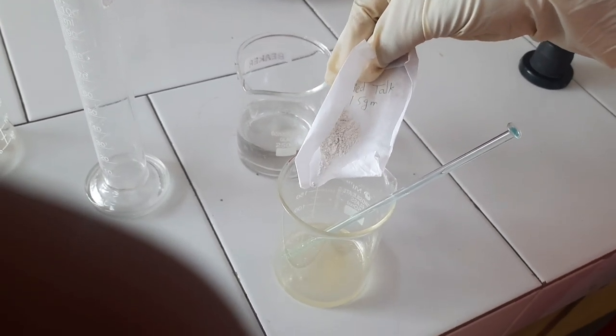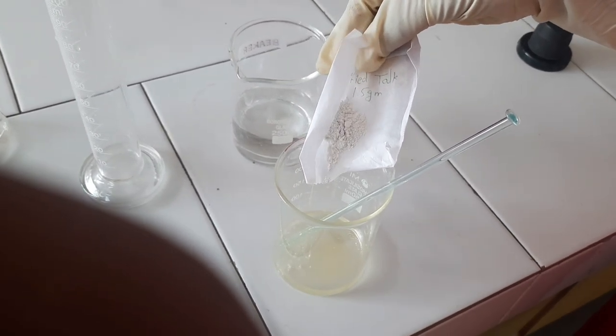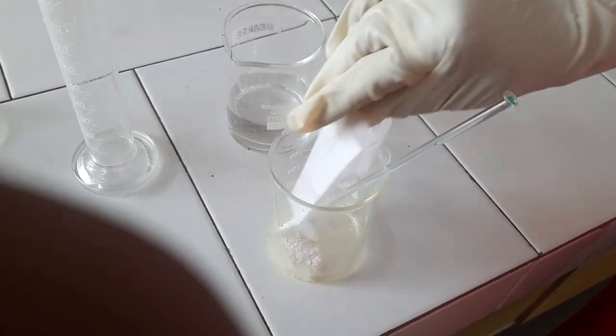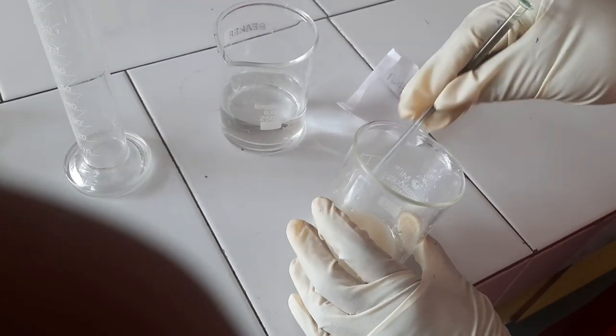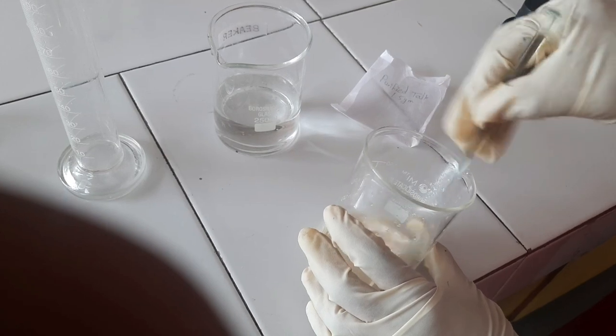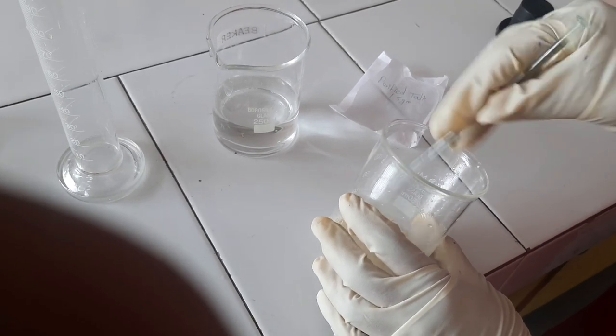Then add calculated amount of talc and stir for 15 minutes. Here, talc is used as a distributive agent.